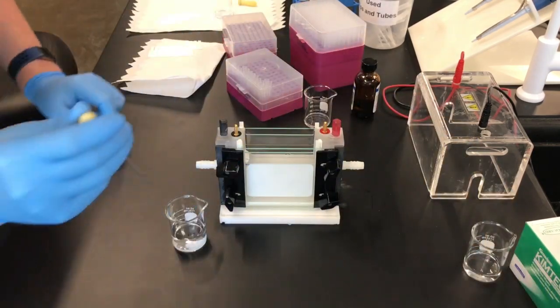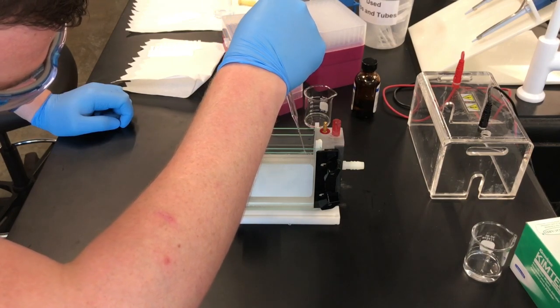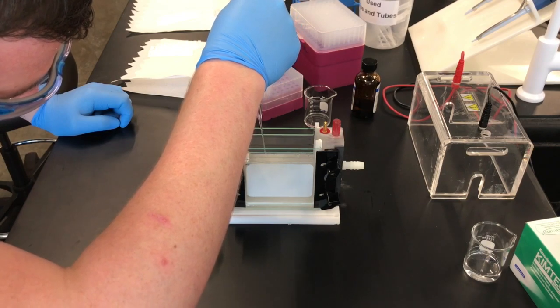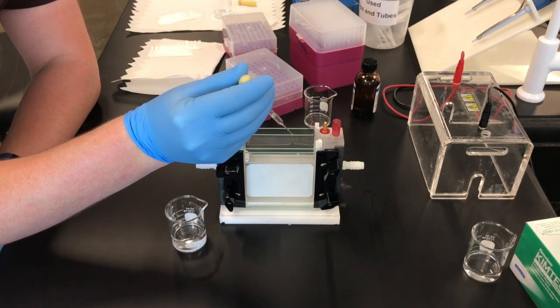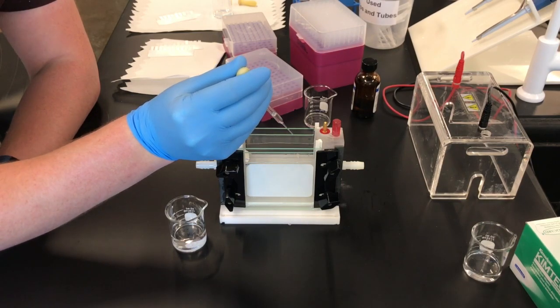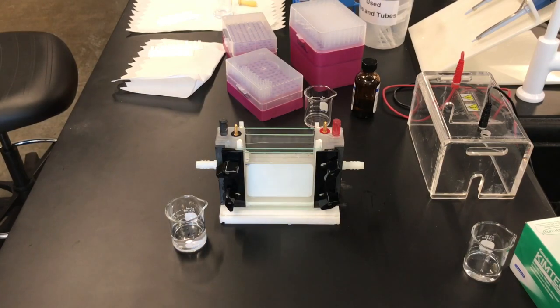After about 5 minutes, you are going to carefully add a little bit of water to the top of each gel. This is simply just so that the gel does not dry out. Carefully drip in a little bit of water onto the gel, so as not to disturb the gel itself since it is still liquid.